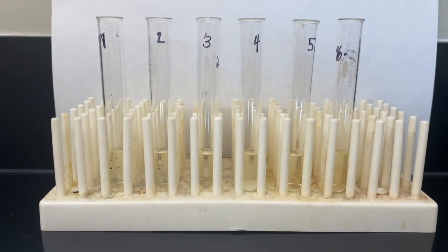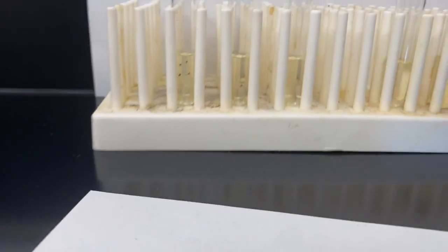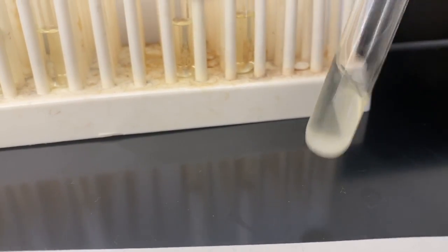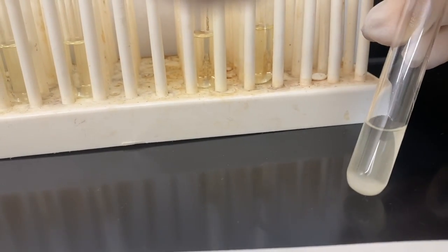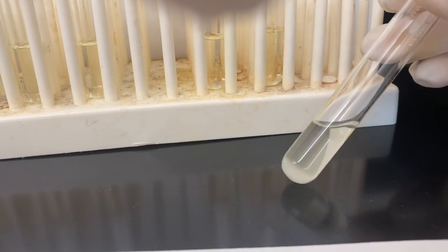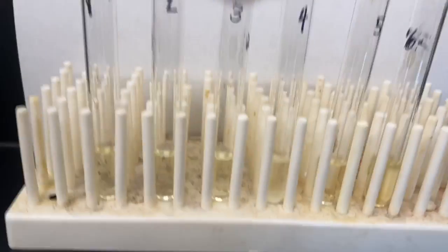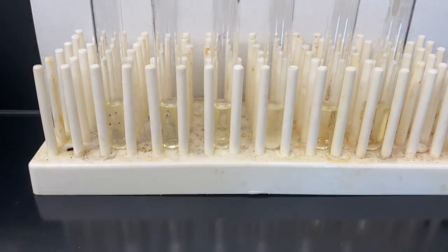Look at test tube 4, we see this cloudy mixture. We even see some precipitate coming out of solution. So if I hold this up against this black background, we see we've got that solid forming in the bottom. What is that solid that's being formed? This solid that forms, right, we're looking for a precipitate, and it really is an indication that the reaction worked. So think about what that could be. In the meantime, we'll heat the rest of these and see if we can get solid to form in the other test tubes as well.